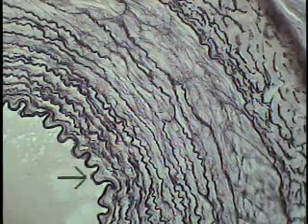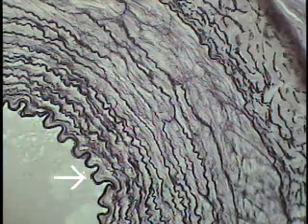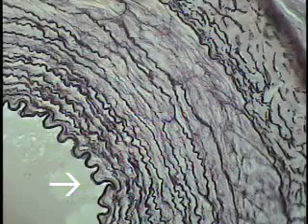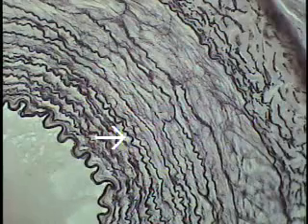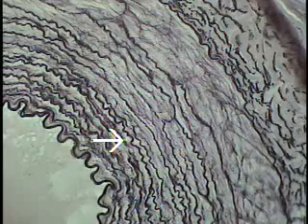An endothelium on a subendothelial layer, that intense internal elastic membrane with its scalloped appearance, much more readily visible with this particular preparation. And then the media, which extends from here to where the tip of the pointer now indicates. There are a few elastic laminae still present, but not as well developed and as robust and as abundant as in the elastic or the conducting artery.